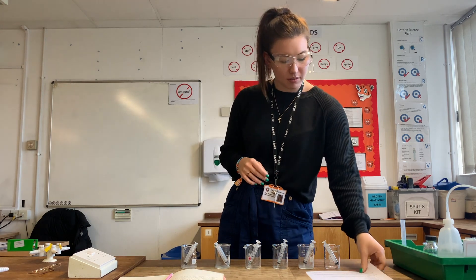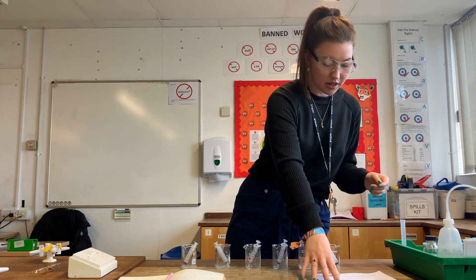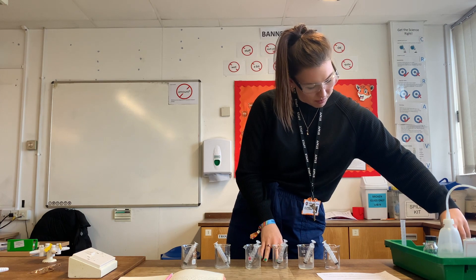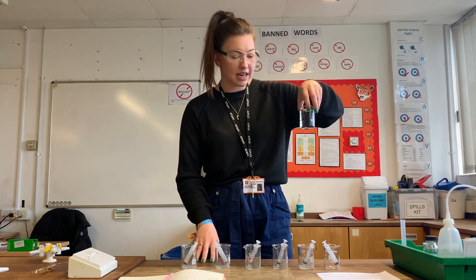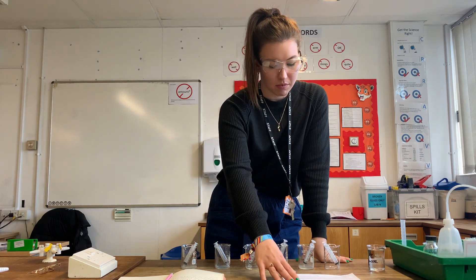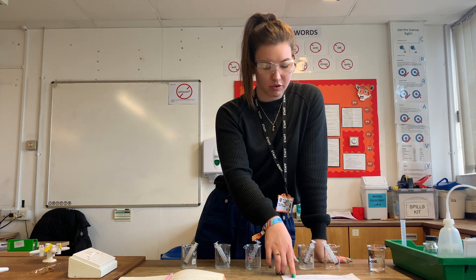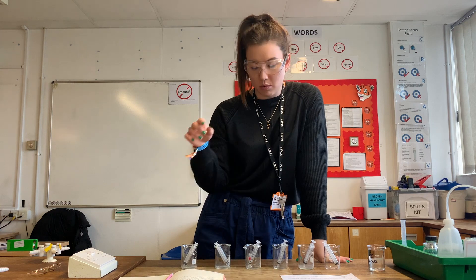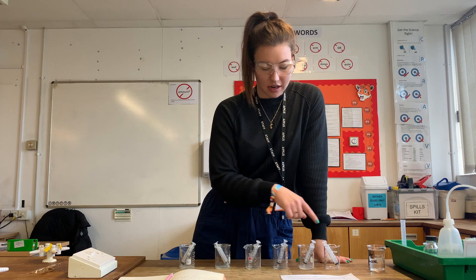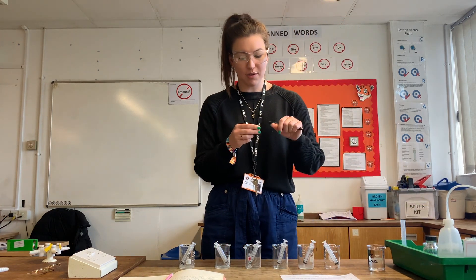The first thing we're going to do is collect 10 centimeters cubed of one percent glucose solution. I've been given some one percent glucose solution and I'll use this to make a serial dilution. We need one percent, 0.5 percent, 0.25 percent, 0.13 percent, 0.06 percent, and also zero percent glucose which will just be some distilled water. I'm going to label up my beakers first so I know what is going where.